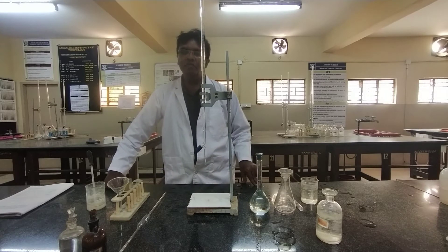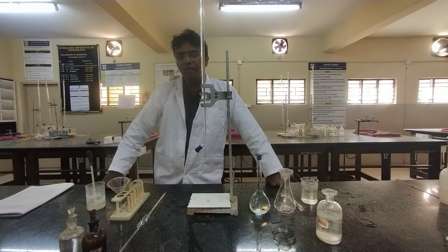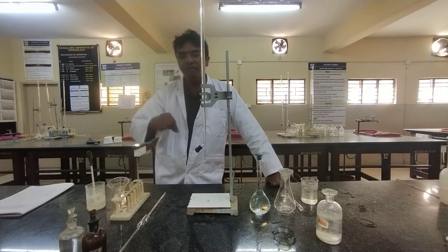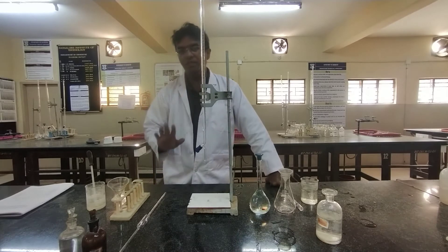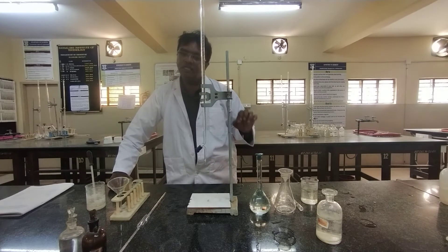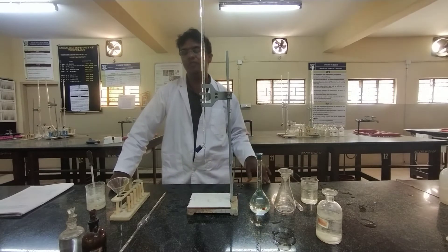Here is a simple experiment to find out the percentage of copper in the brass sample. Instead of giving you a piece of brass, we will prepare the brass solution and provide it to you. The first step of the experiment is preparation of 250 cm³ of the brass solution. A concentrated brass solution will be given to you, which you have to make up to 250 cm³.